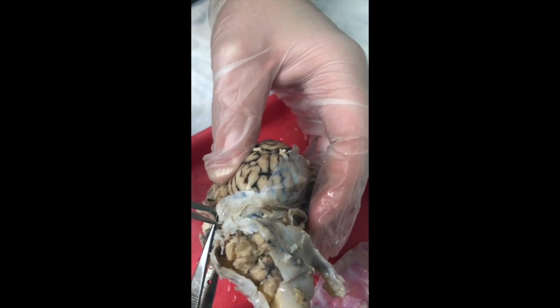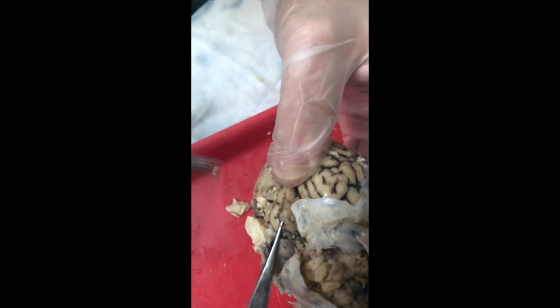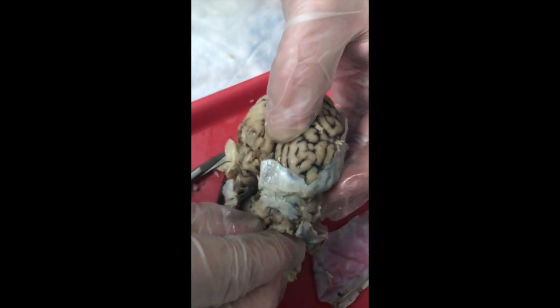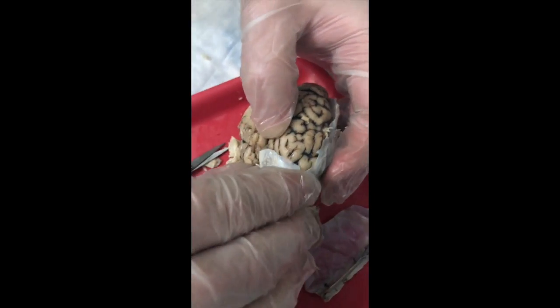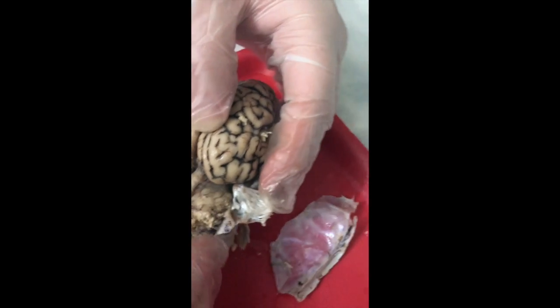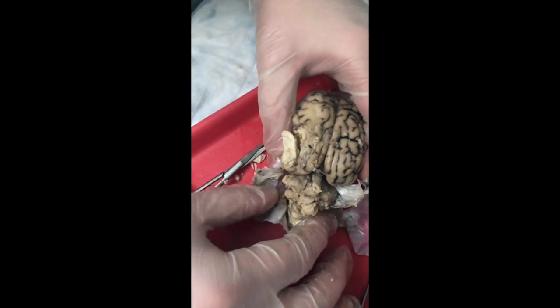It's cut. And look how far down. Right. Once it's cut, you should be able to feel it release and lift the two pieces away and just snip the edges off to expose everything right there. So now we have the entire brain exposed.